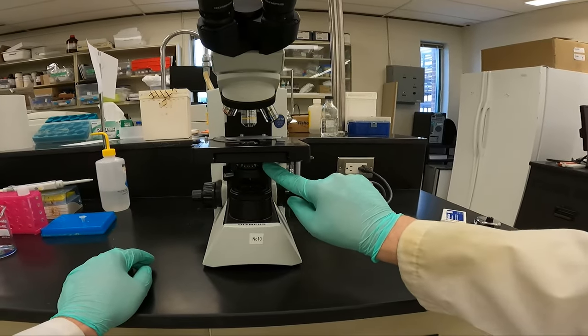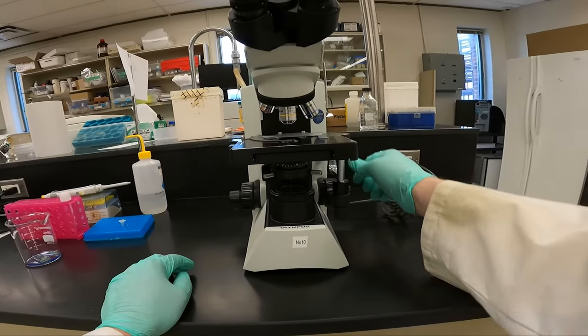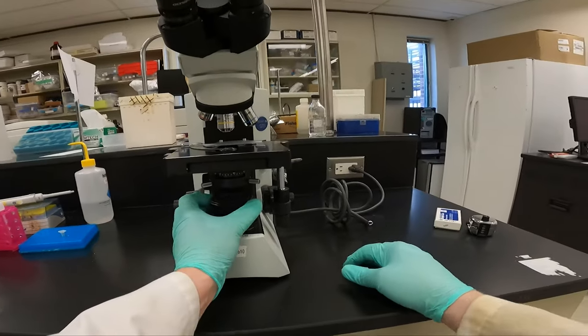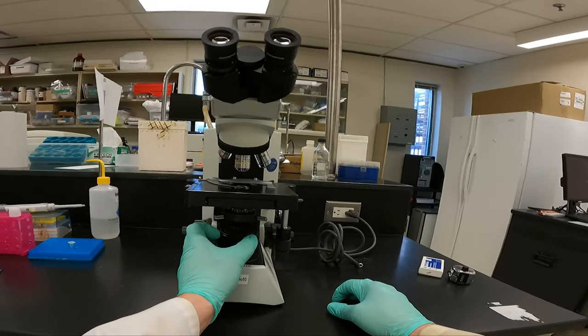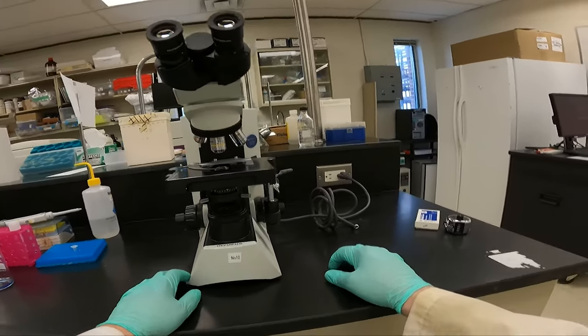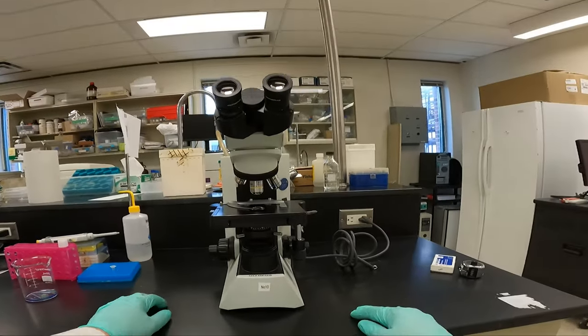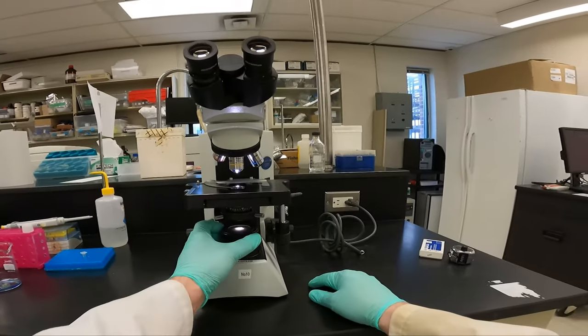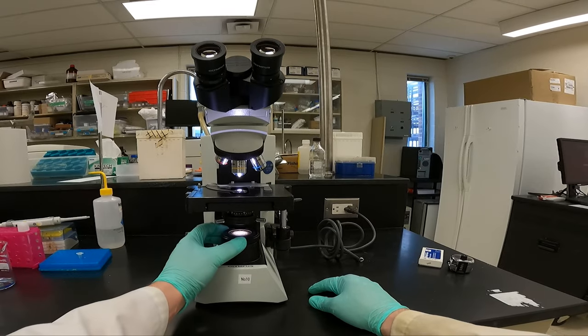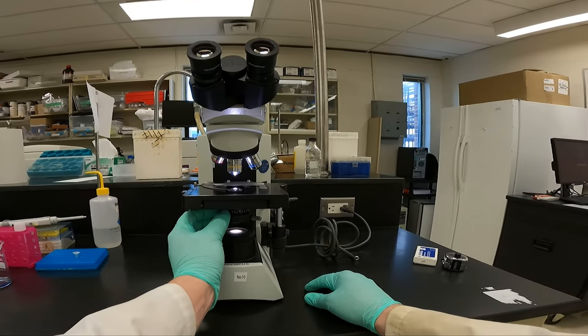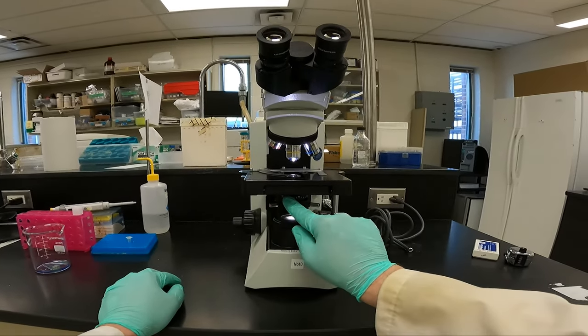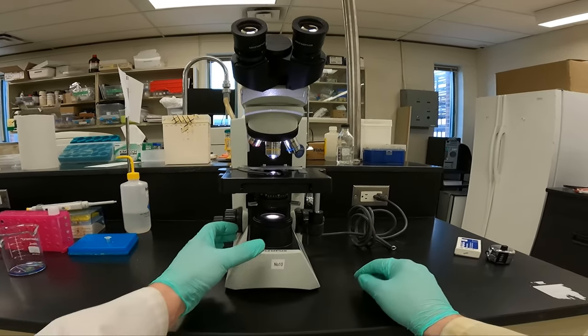We have our iris diaphragm down below here, slides open. With the lower diaphragm, we want to adjust it so the light is just reaching the edges of our field of view. And the iris diaphragm, we want to close it to try and increase the amount of contrast.